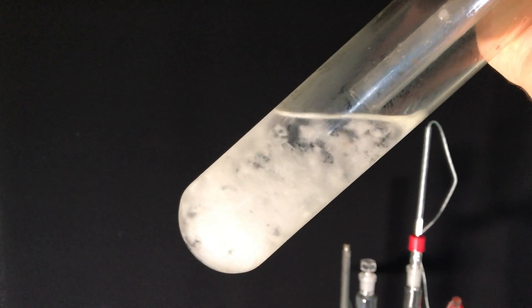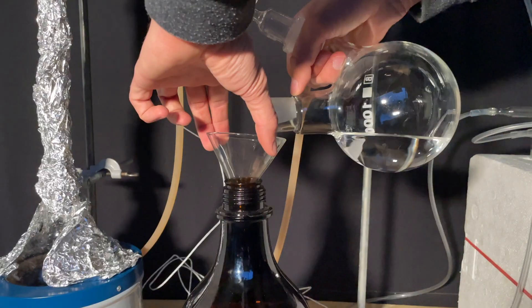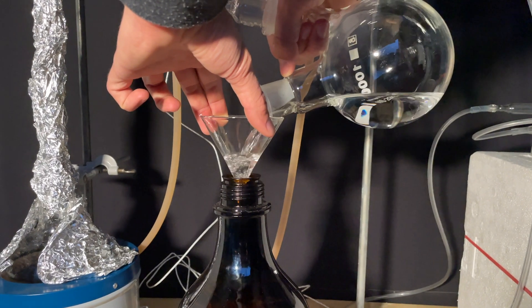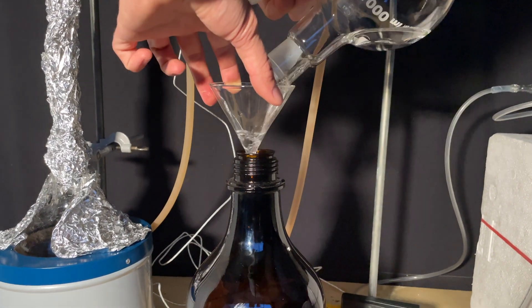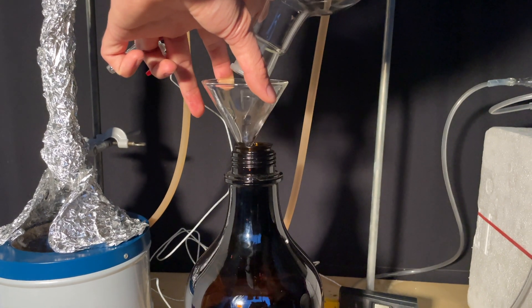There you go, all of that liquid in the cold trap. It's mainly benzene and it will be collected in my waste canister. I ran vacuum distillations for 10 hours straight and this was the product after the last vacuum distillation.